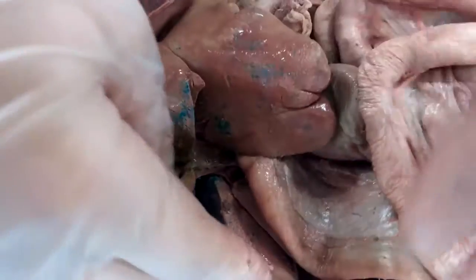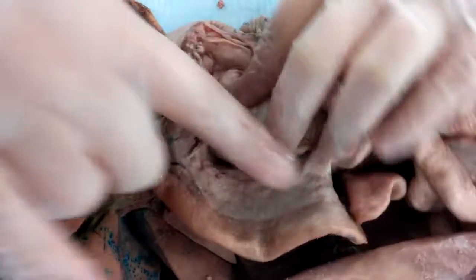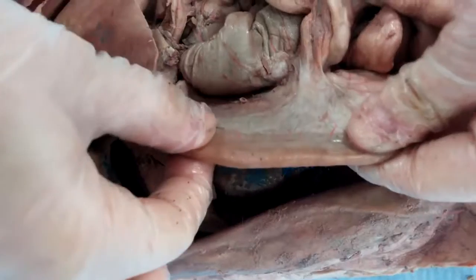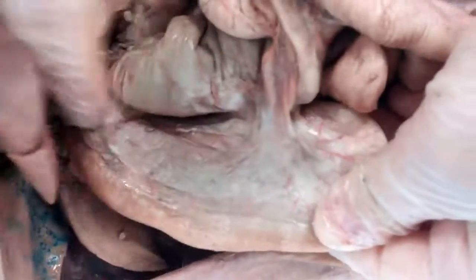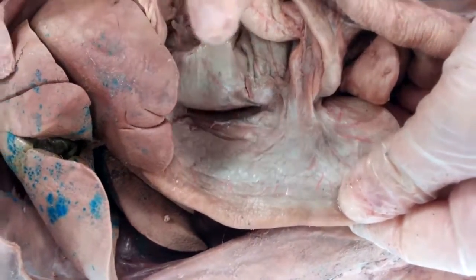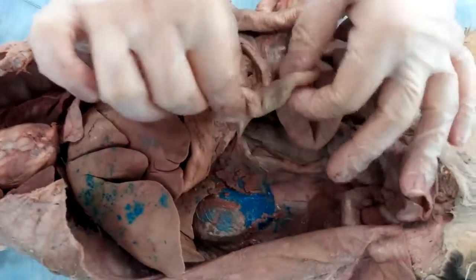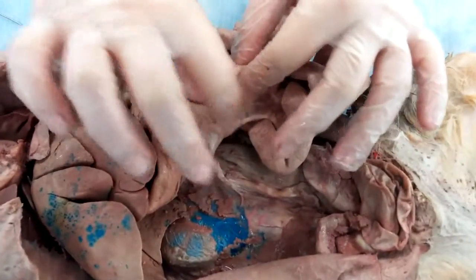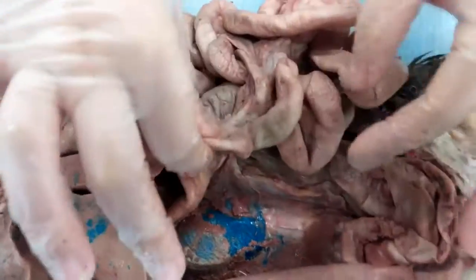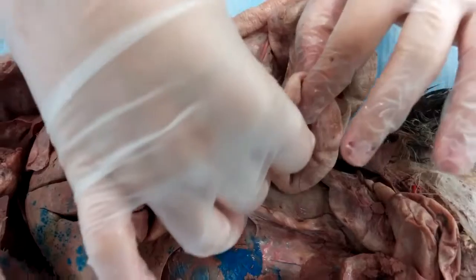We have the pancreas, which is this part right here. Don't confuse this whole thing as being the pancreas — this right here on the outside is the duodenum. This right here, this roast-beef-looking thing, is the pancreas. So we have the duodenum here, and then you see this little indentation right here, and the duodenum connecting to the rest of the small intestine is the jejunum.